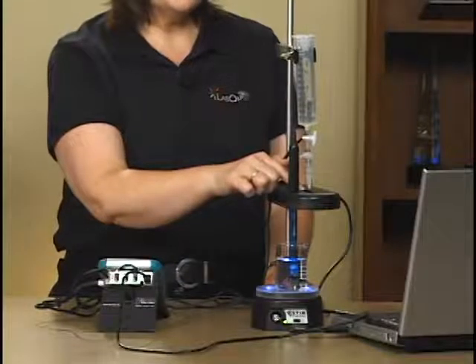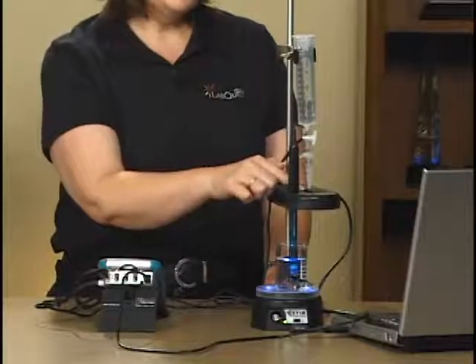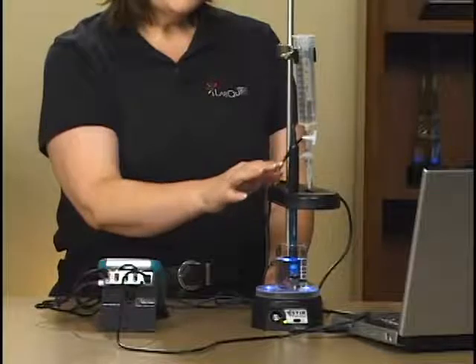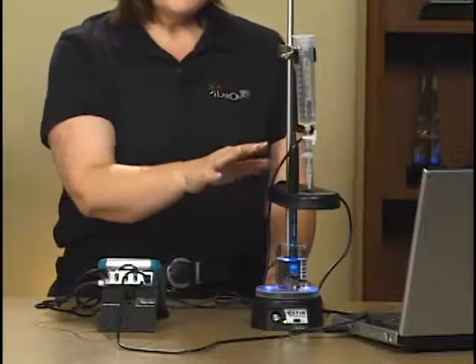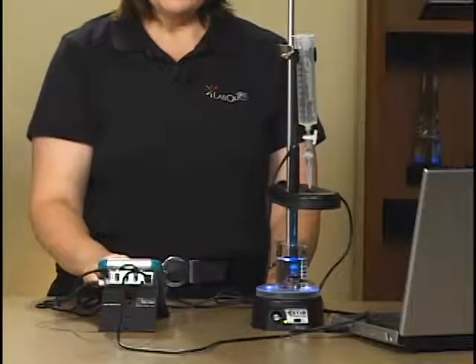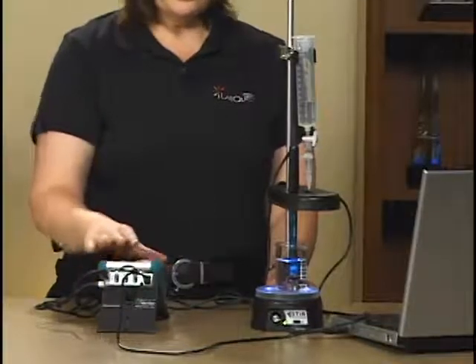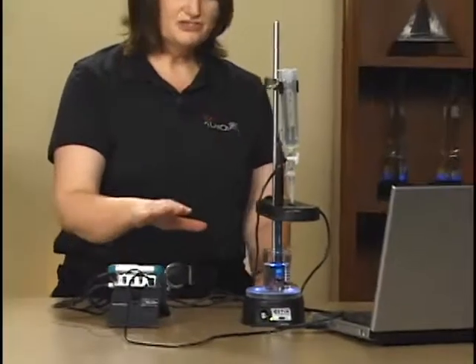These two sensors, the drop counter and the pH sensor, are connected into the Lab Quest interface. For this particular lab we're going to attach the Lab Quest to a computer through a USB cable and control the titration with Logger Pro on the computer.